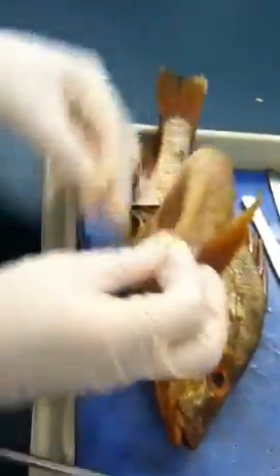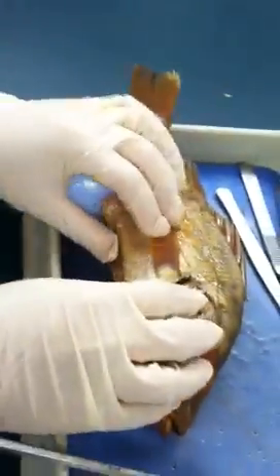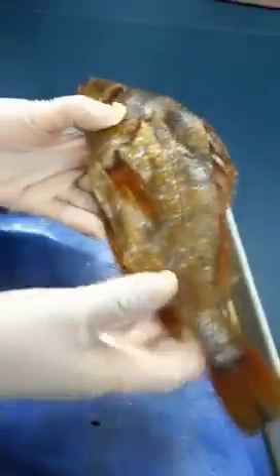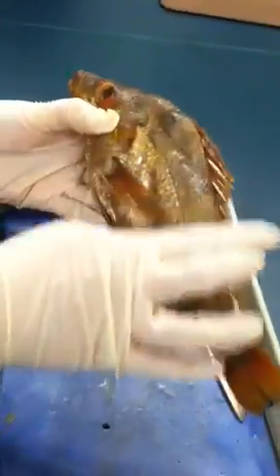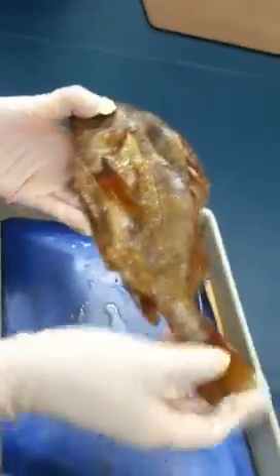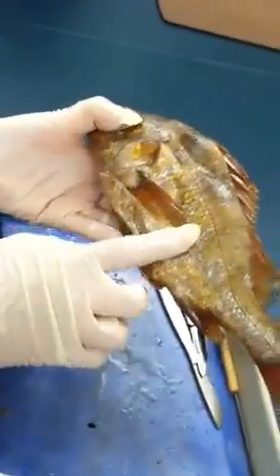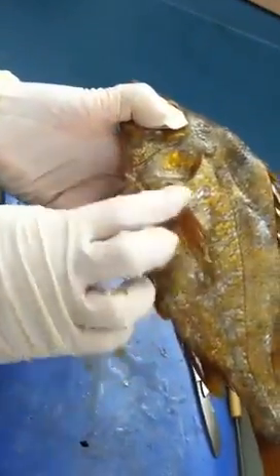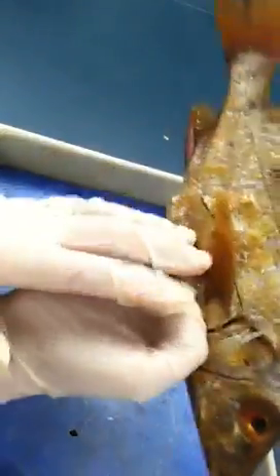So here, as usual, we start from the external. So for external, they have different parts of fins. This one is what we call pectoral fins — it's on the side, on both sides, one on each side.